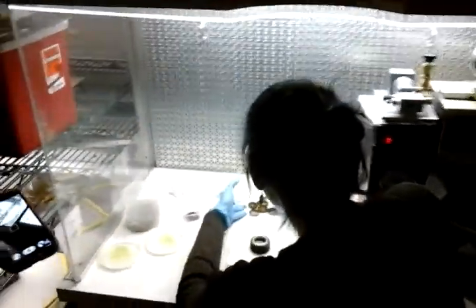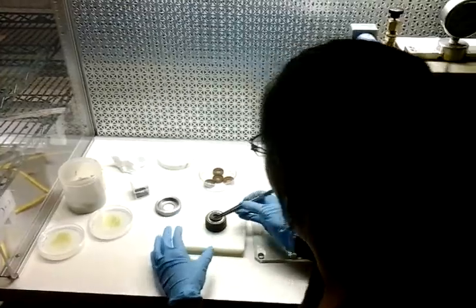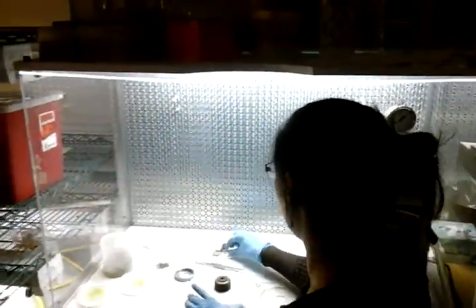I'm going to take one of these and screw this in. There is a box of goggles back there — if everyone could grab a pair of goggles.